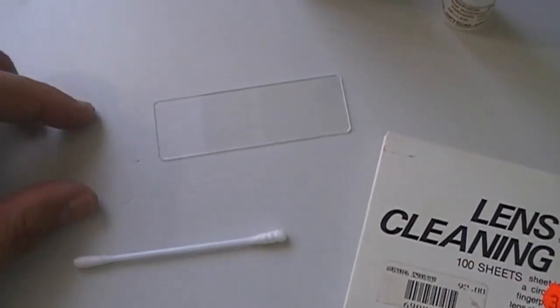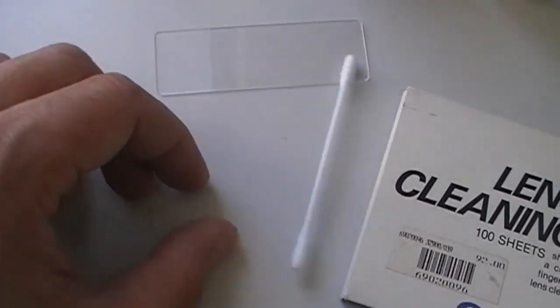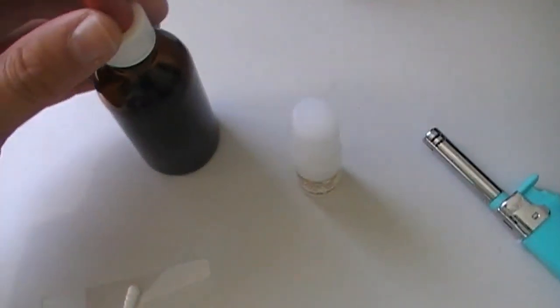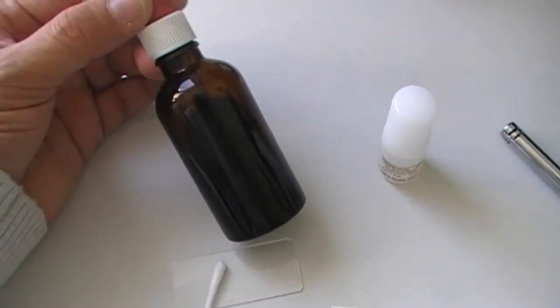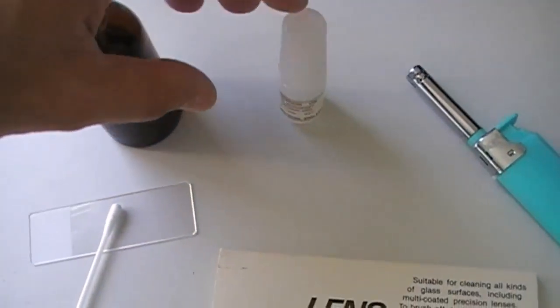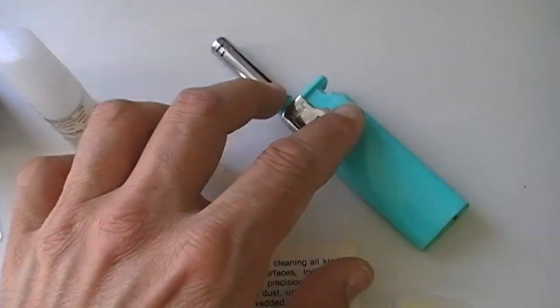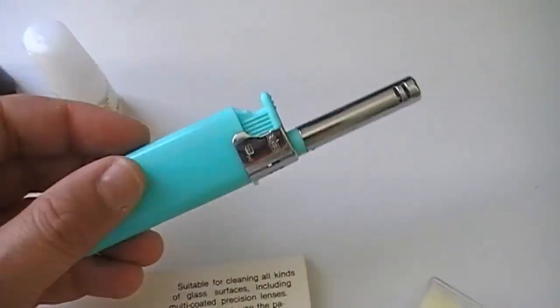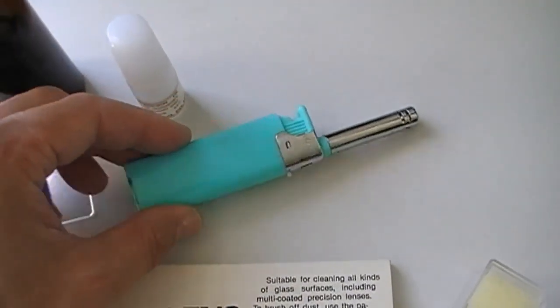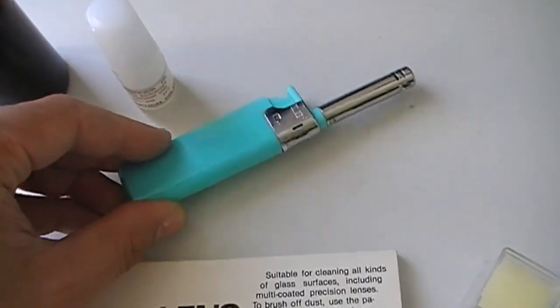So what do you need? Of course you need a slide. We will be using q-tips to extract the cells, some lens cleaning tissue to remove the oil. Over here I've got some fountain pen ink — not calligraphy ink, just regular water-based blue fountain pen ink — immersion oil for the oil immersion objective, and a gas lighter. This is important for heat fixing the cells. It's got to be a gas lighter, otherwise we have the problem of soot forming on the slides.